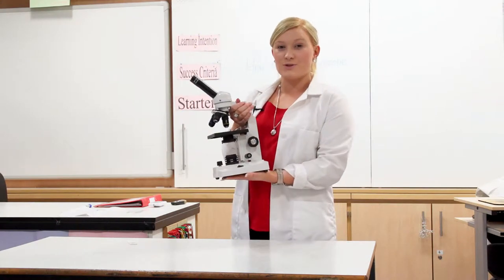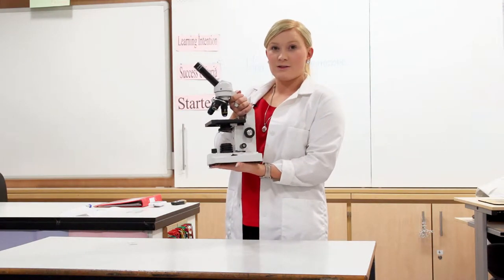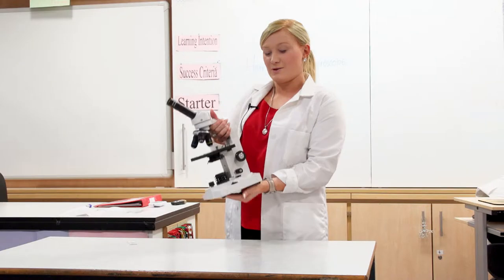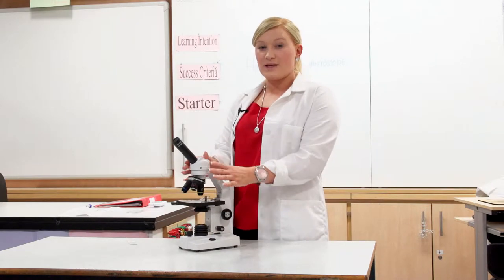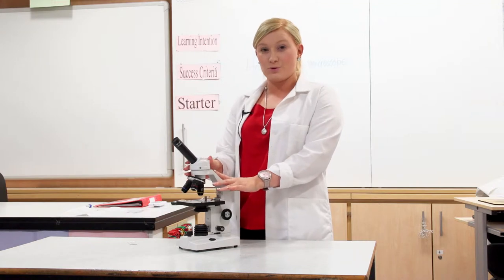When carrying a microscope, always use two hands—one hand underneath the base and one at the neck of the microscope. When using a microscope, you need to know all the different parts, and your worksheet will show you this.